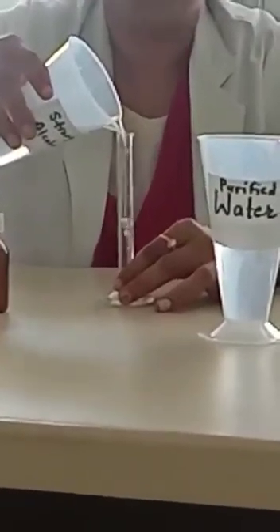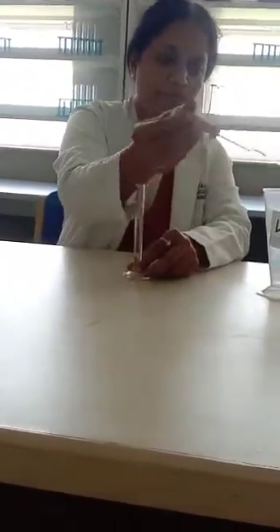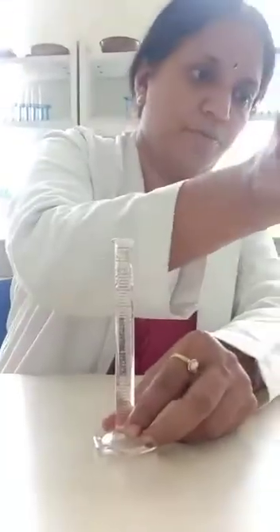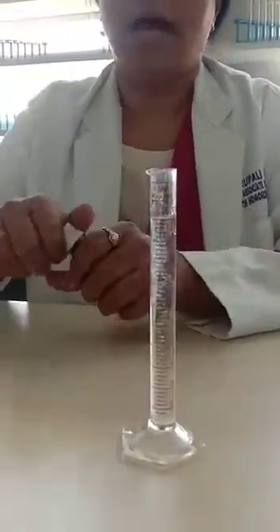We have taken a measuring cylinder and strong alcohol. Now we are going to measure about 7 ml of strong alcohol. Now we have taken 7 ml of strong alcohol. To this, we are going to add 3 parts of purified water, so that it will be 10 ml of dilute alcohol.